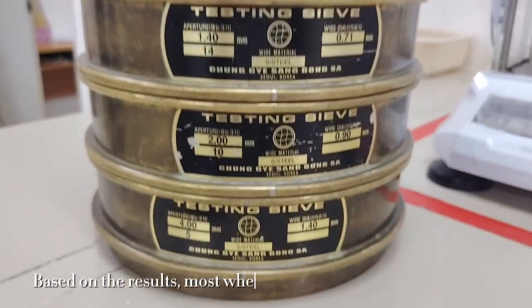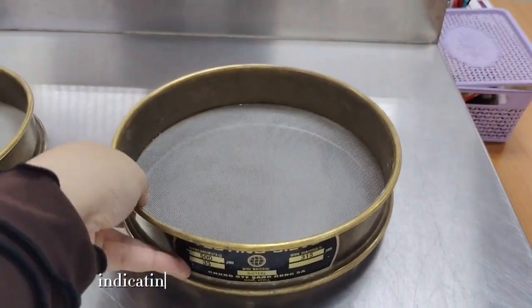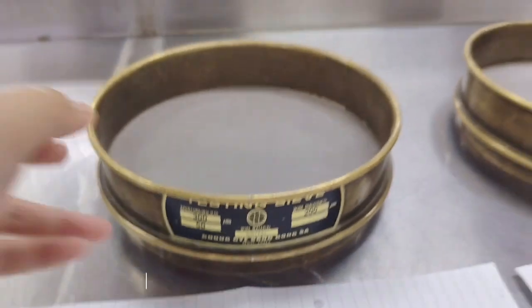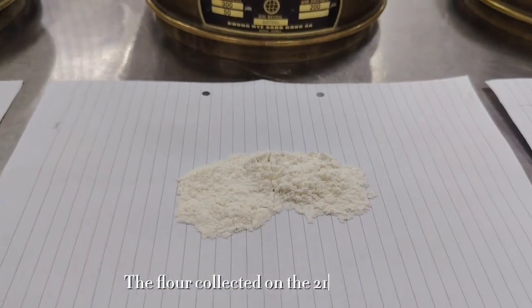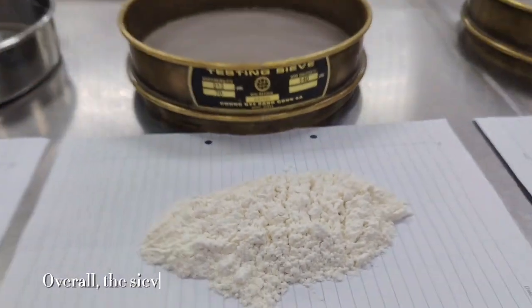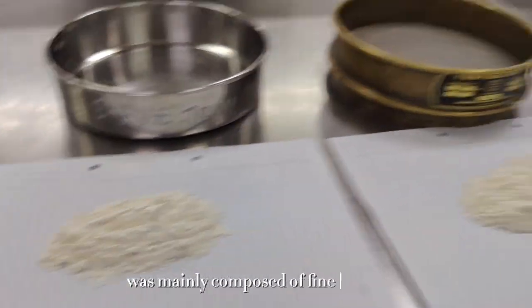Based on the result, most wheat flour particles were retained on the 500 micrometer sieve, indicating that the sample mainly consisted of medium and fine particles. No material was found on the largest sieve, showing very few coarse particles. The flour collected on the 212 micrometer sieve and in the pan confirmed the presence of fine particles. Overall, the sieve analysis showed that the wheat flour sample was mainly composed of fine particles.